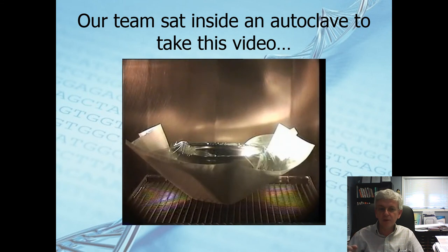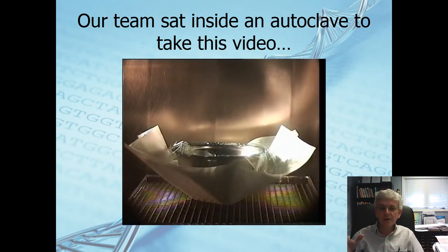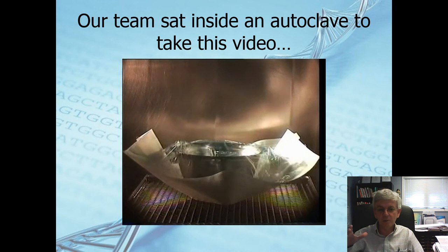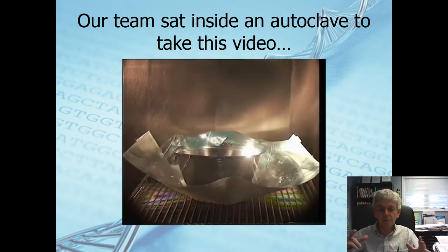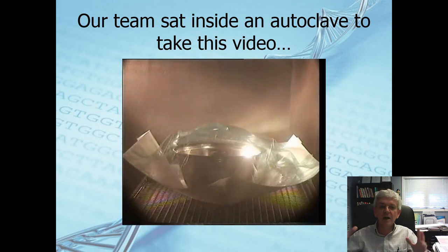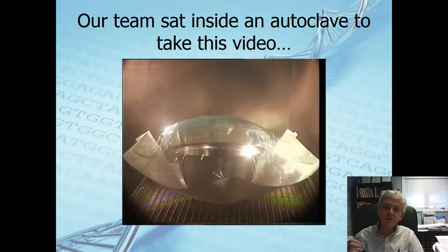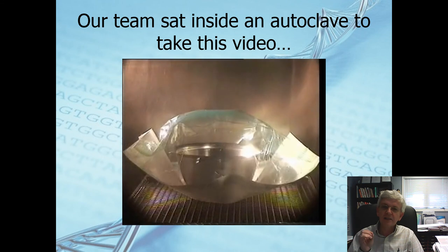Now you get a real good feel for what this thing looks like inside here. Now you can see this is coming back. The pressure is being released. And in a minute you'll see some of this coming in. It will start pumping in some of the steam in here. Here comes the bag. It's coming back up. Now you can see the steam coming in, that super hot steam.